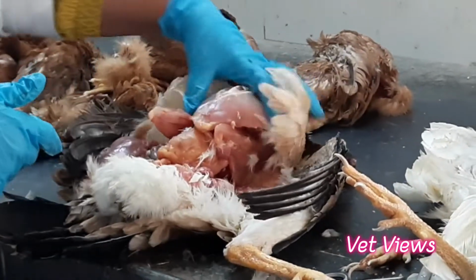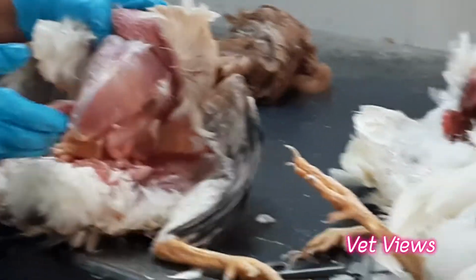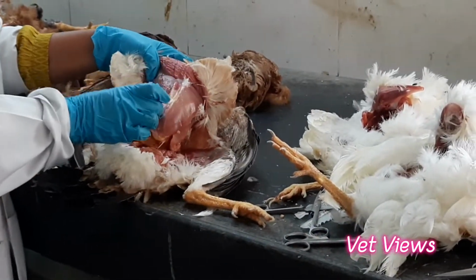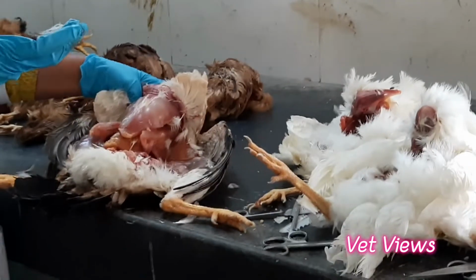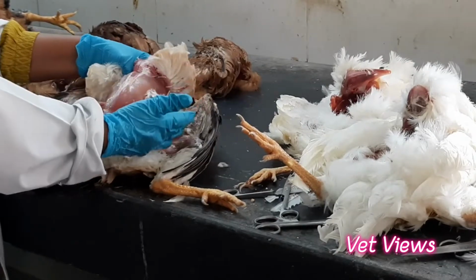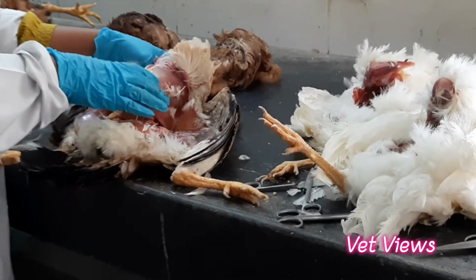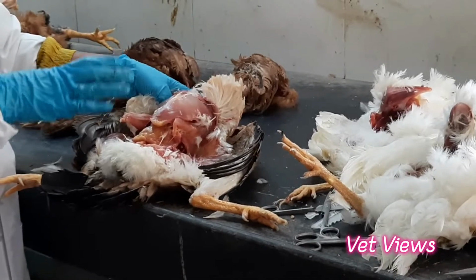Also, in case of heat stress, especially during peak summers, you can easily find out whether the bird has died of dehydration and heat stroke. There will be patches of cooked appearance. When you cook chicken, it turns white first. Like that, wherever it is exposed to heat, usually on the one side where the birds are lying in the cages, that side will be completely white, like cooked meat. That gives the indication that the bird has undergone heat stroke and then died.